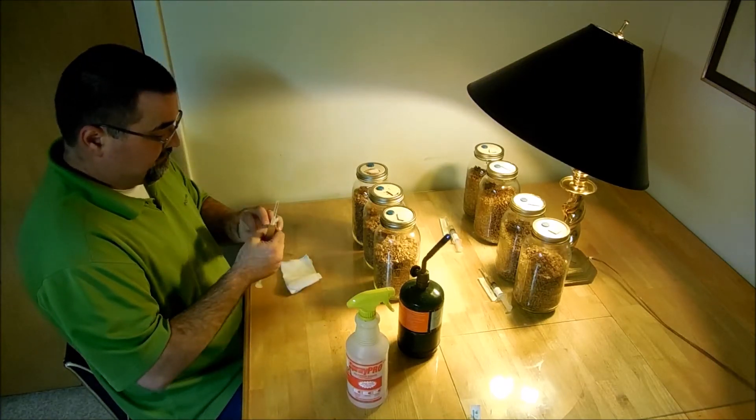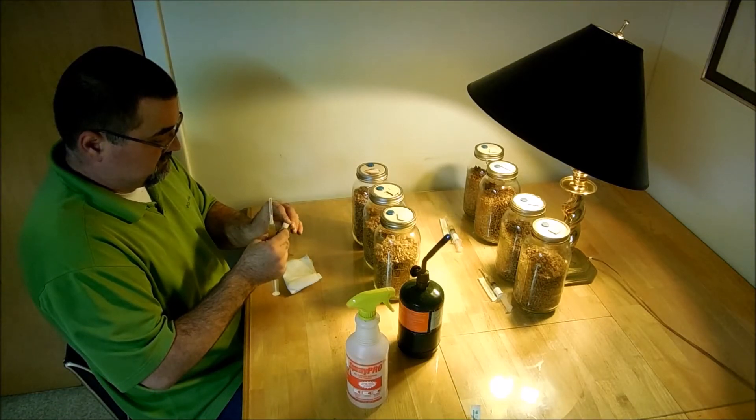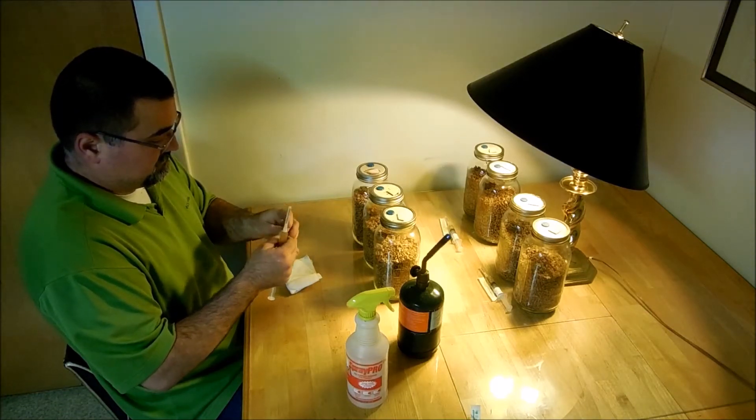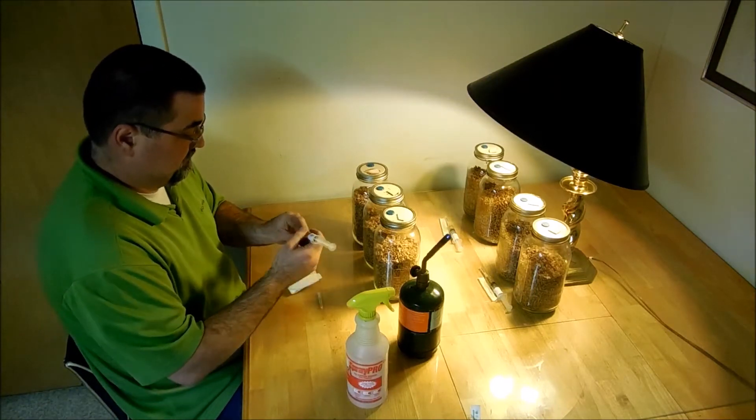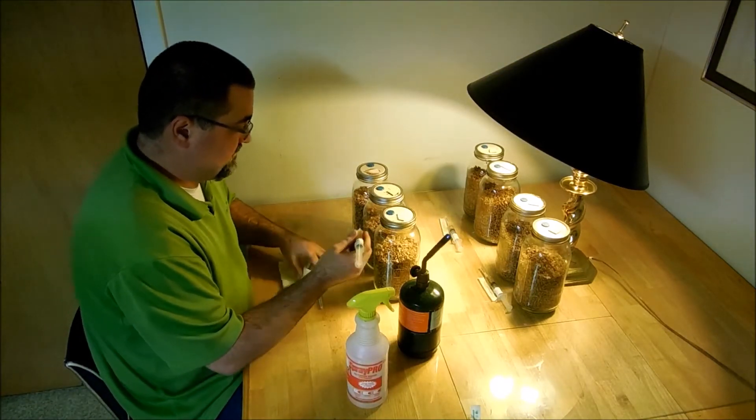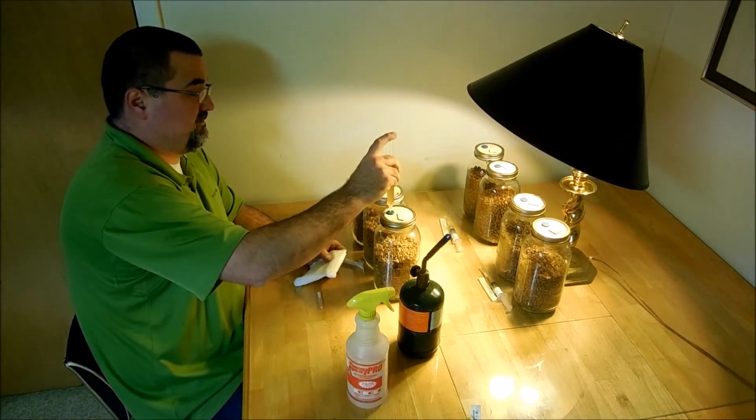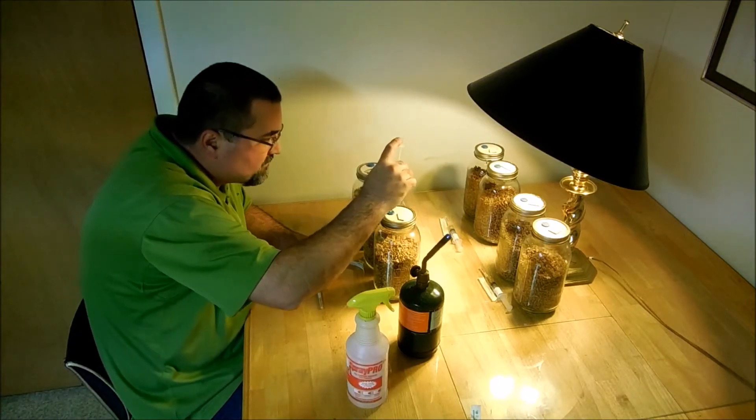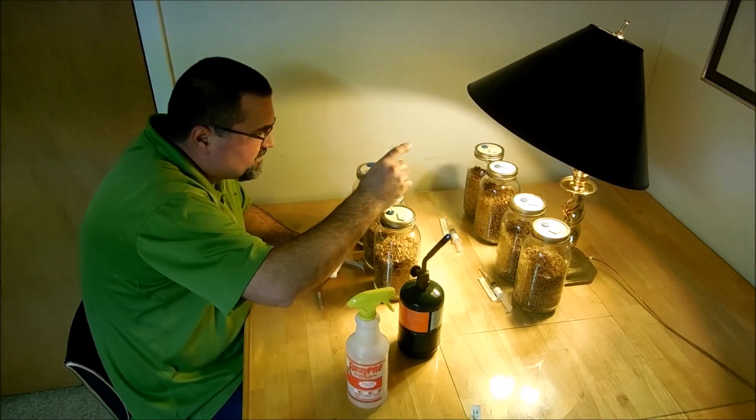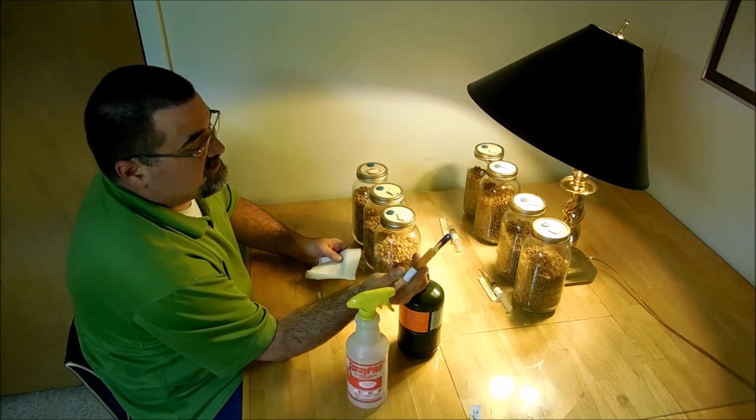I'm going to go ahead and install a fresh needle. Since the needle is sterile from the factory, I'm just going to put it in there. I can't read it. It looks like two, I can kind of see through. So I put two cc's in there.